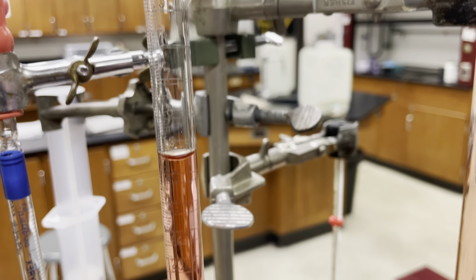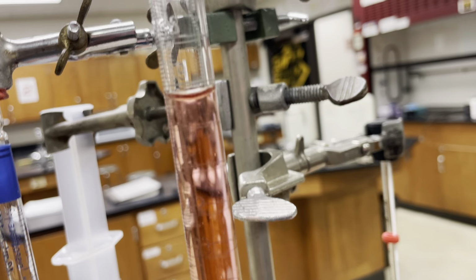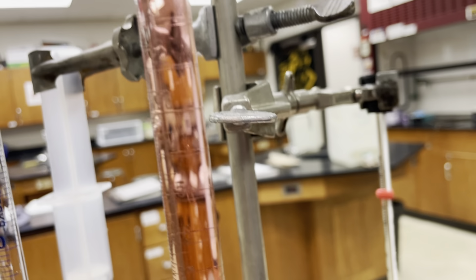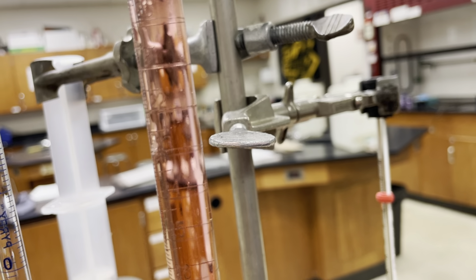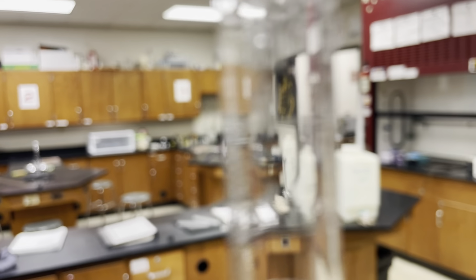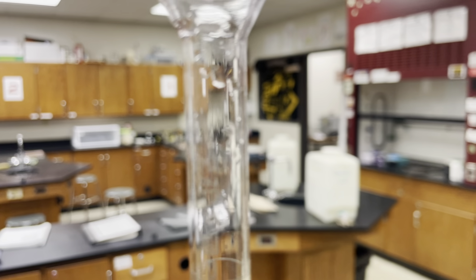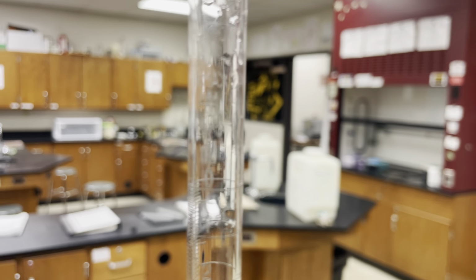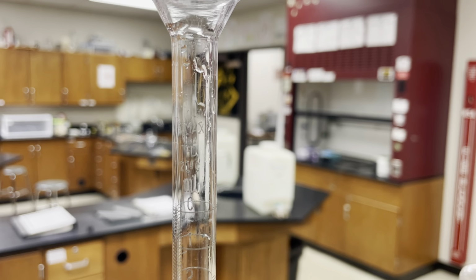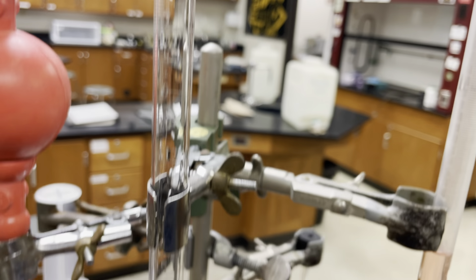We usually use this to figure out how much liquid we've put out into something else. So you know your starting mark, and then you empty some liquid out, and the level gets lower, and the difference between those two levels is how much liquid you released. If you start right on the 0, then it makes it easy for you. Also I want to point this out, if I can get it to focus again. There is a little TD right there, which means to dispense. In other words, that's why we're counting down here.